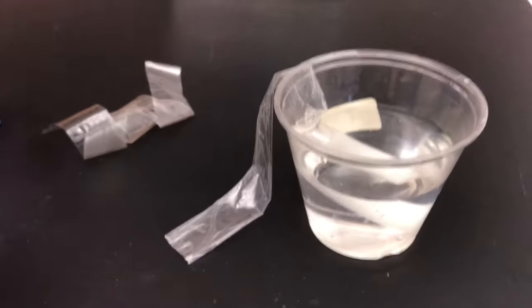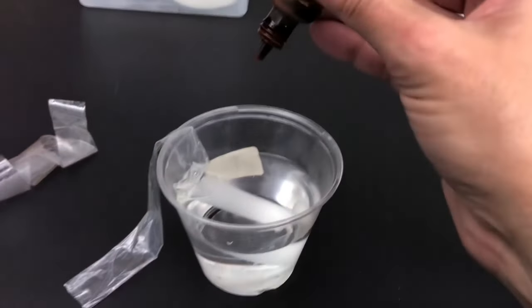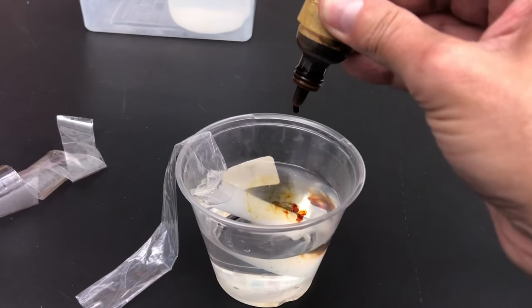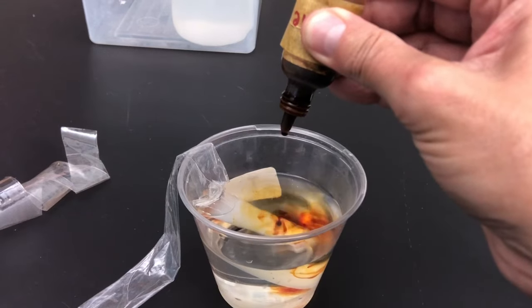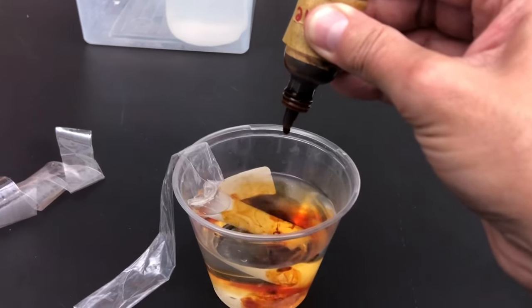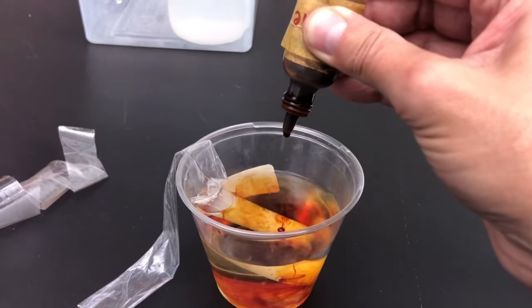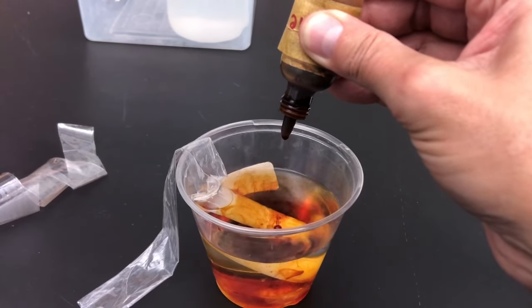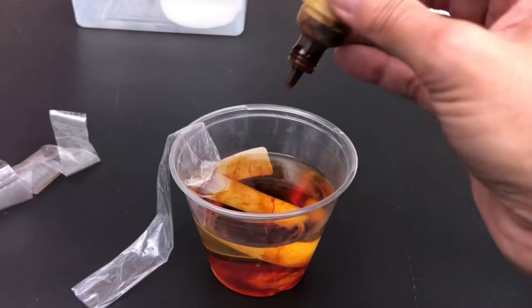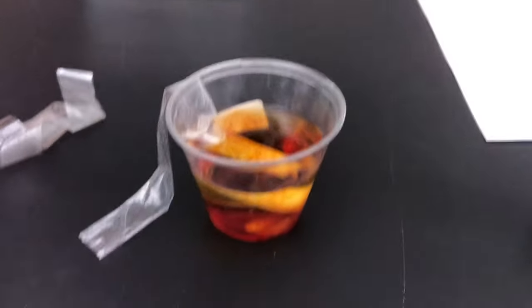Now I'm going to take my iodine and add about 30 drops into the cup — it doesn't have to be exact. I counted out 30 drops, and added one extra drop for good luck.